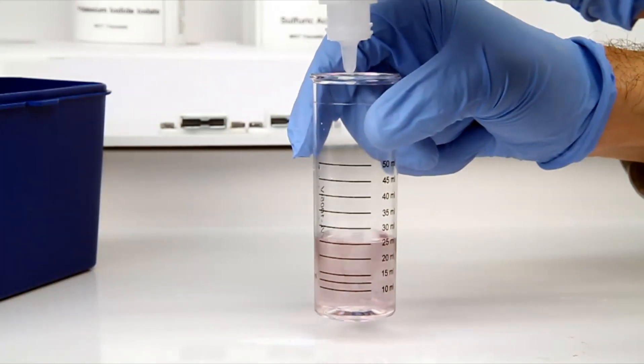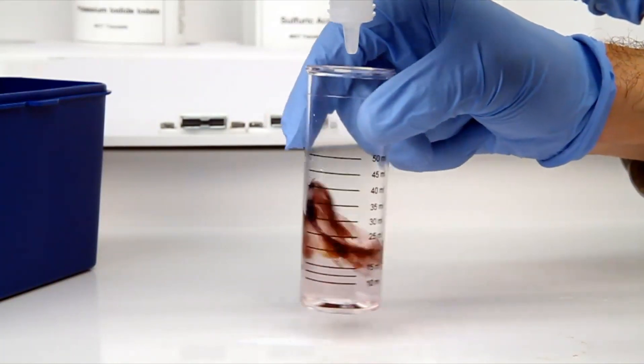According to the endpoint ID procedure, the titration is complete when the sample has changed from colorless to blue.